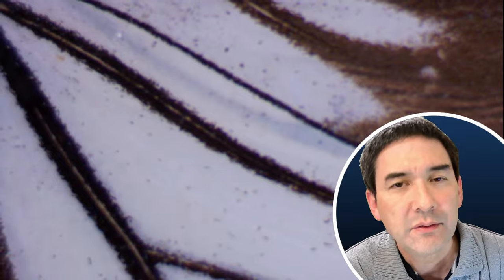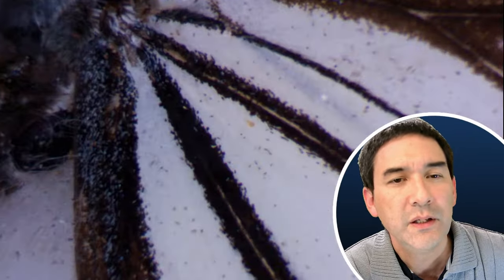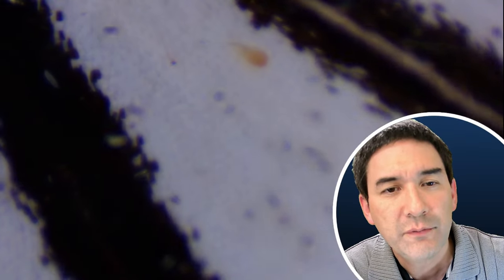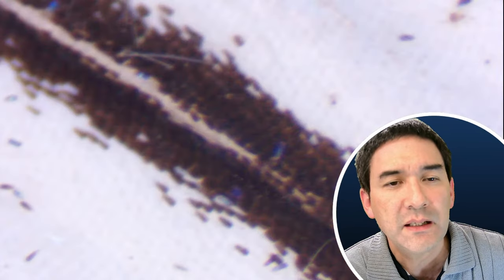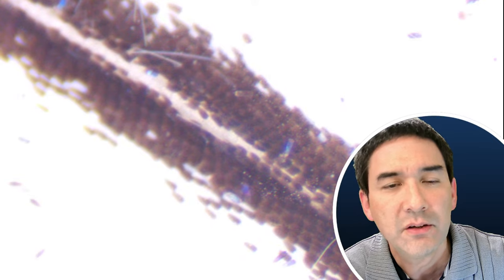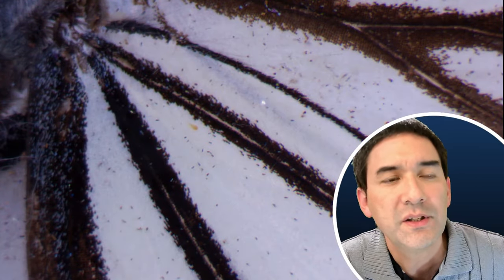I'm going to change to the other sample. When we zoom in and refocus, we're able to see the individual black scales. What I'd like to do is a little bit of focus stacking. You might ask what there is to stack since the wing is quite flat — but I'd like to specifically do a focus stack of the head of the butterfly.